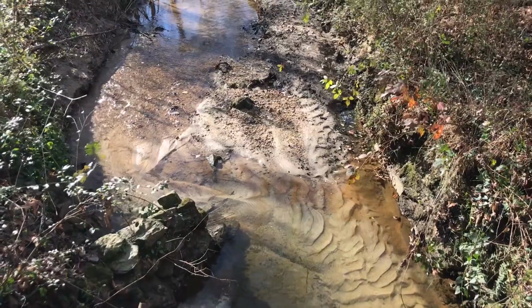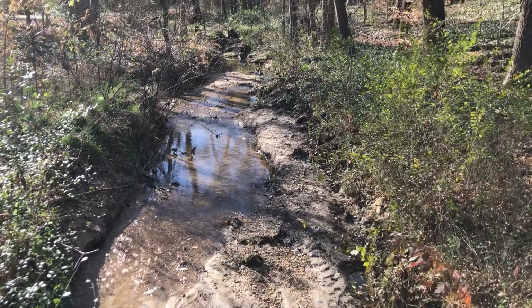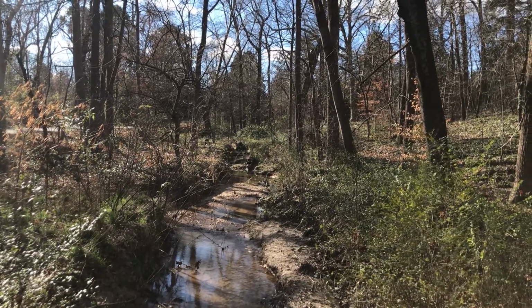My name is Kelsey, children's educator here at Ginter Botanical Garden, and this week we are water testing. At the garden, we have a water quality monitoring program, and we sample water from streams and ponds and lakes all in the garden and around the perimeter, because that water can tell us a lot about the environment around us. First, I look around and take data about the weather.